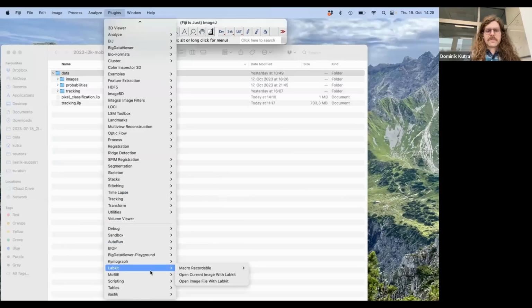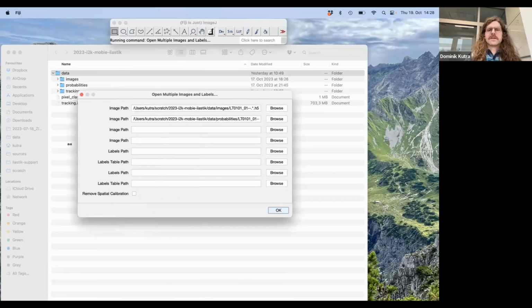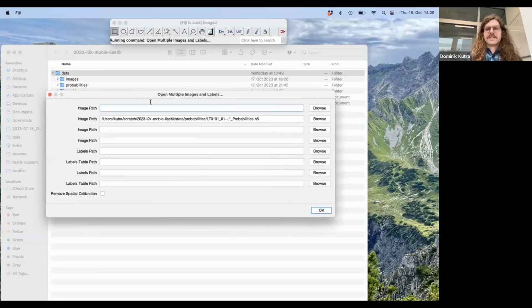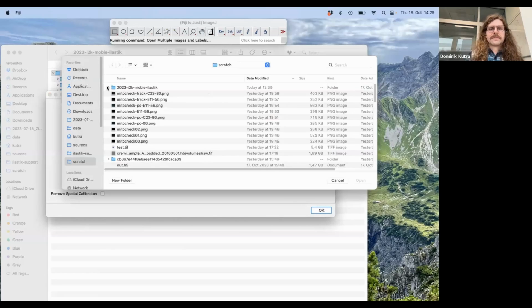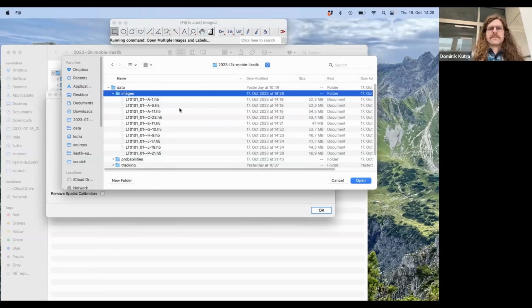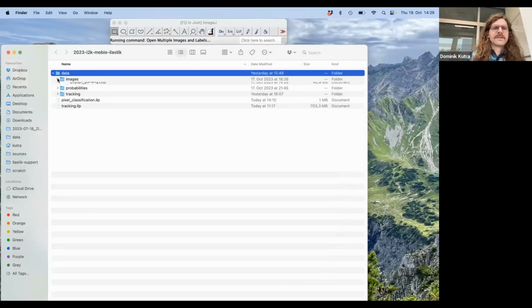So if I now go to MoBIE, in order to open multiple images, and this is what we have from pixel classification, we generated a probability image, and we want to view it on top of our raw data. This is why we will take the open multiple images and labels option, which opens a rather large dialog. Now you have to imagine that there's nothing there. You choose your first type of image by browsing to it, and for me this would be the images. I select the first one, and maybe if we open this in the background here, it might be more apparent.